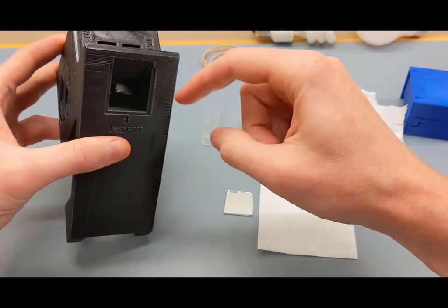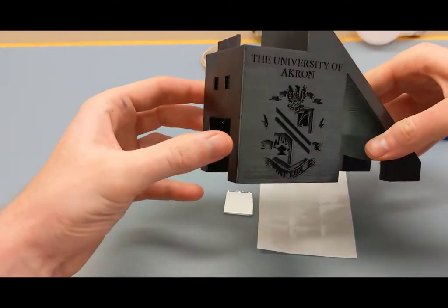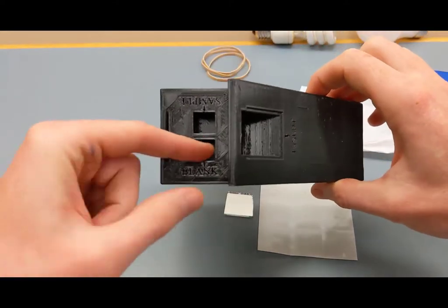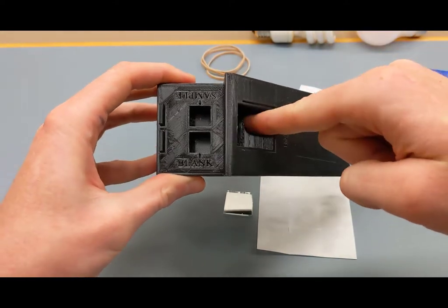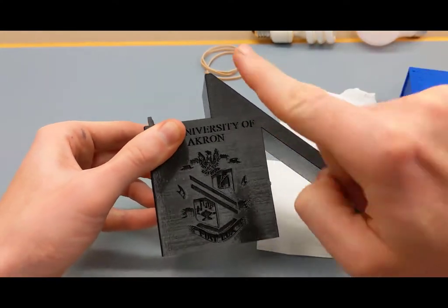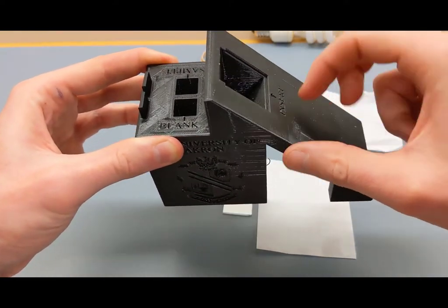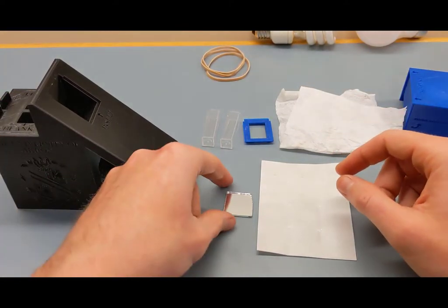The mirror goes on this 45-degree ledge inside the base. Light passes in through the aperture and through the slit, then through two cuvettes, hits the mirror at 45 degrees, and is reflected vertically to where your camera will sit — serving as the spectrometer sensor. So we need to prep the mirror.